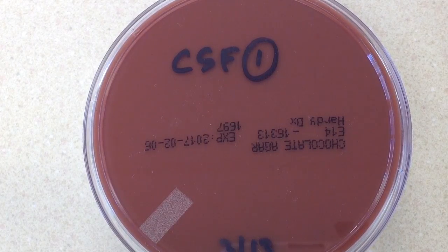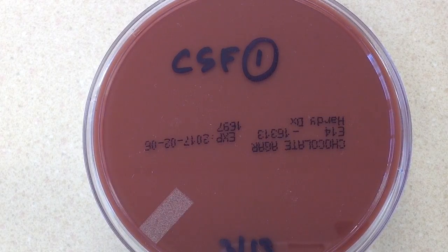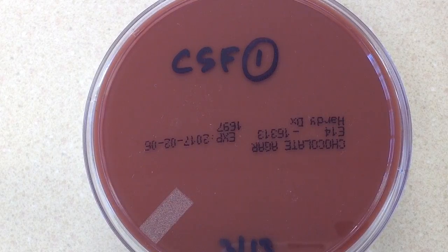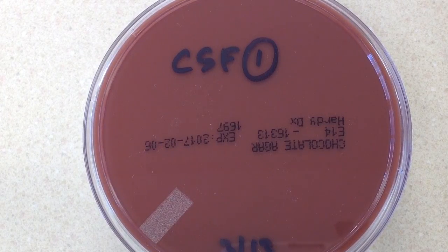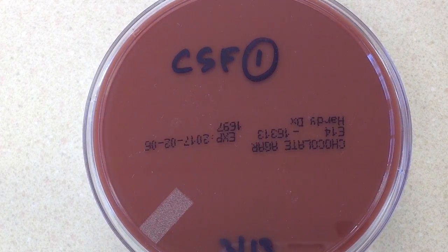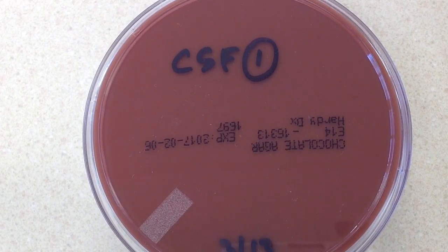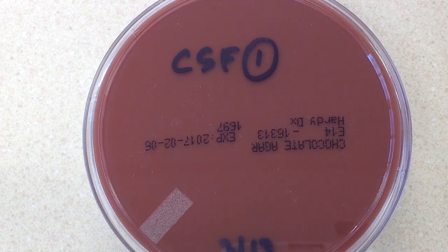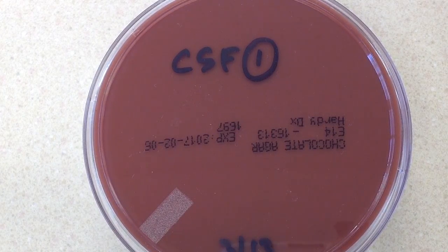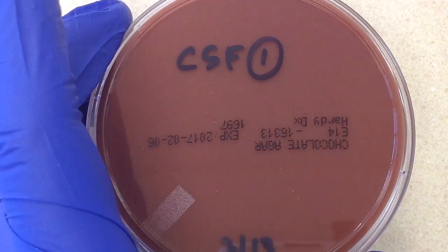Looking at the gram stain, we can see that we have gram negative cocci in the direct smear. The direct smear always serves two functions: it gives the tech at the bench an idea of what's going to be growing on the plates, and it also gives the physician information without having to wait a full 24 hours to see growth on the plates.